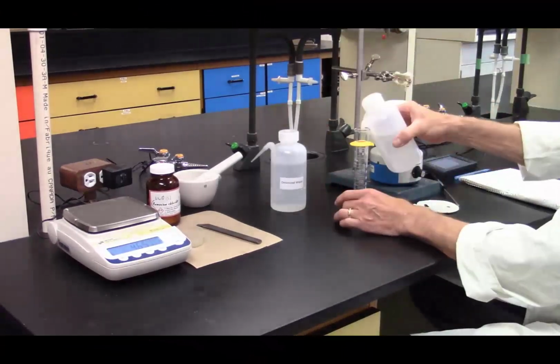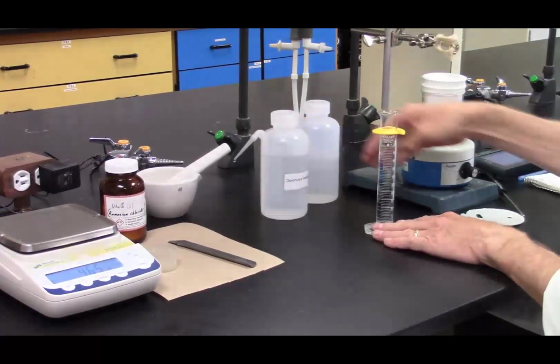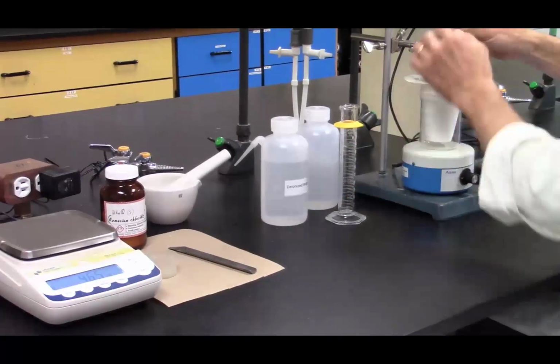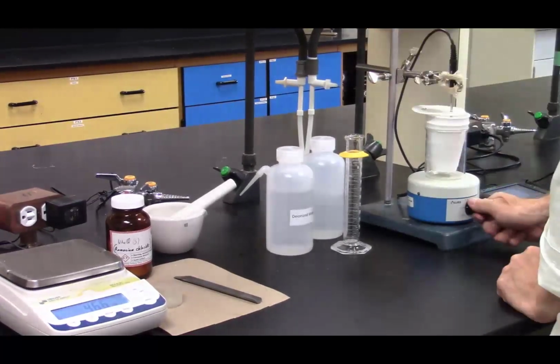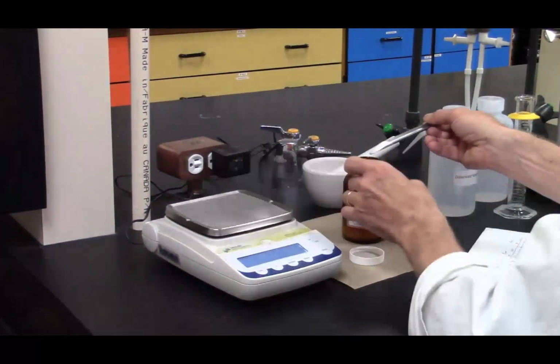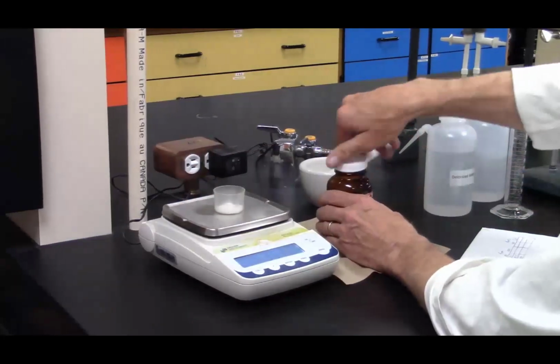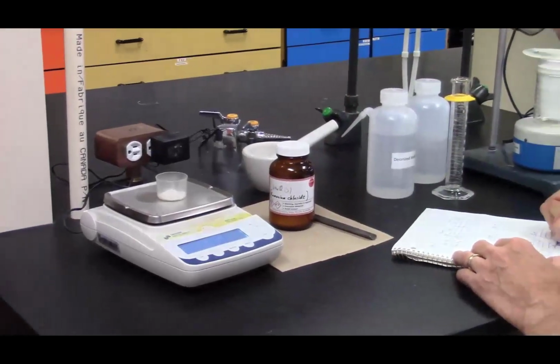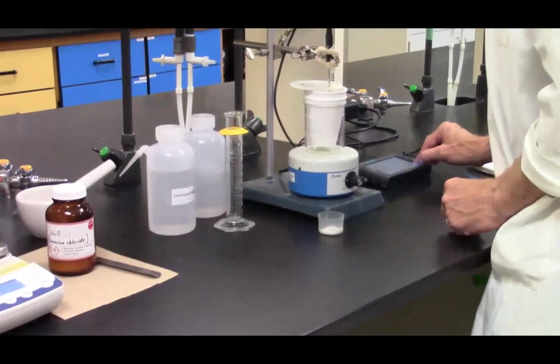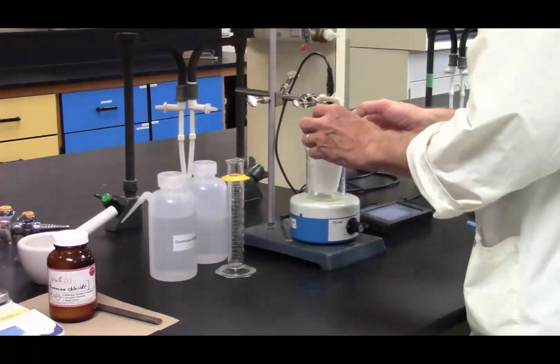In the lab, we see Scott use a graduated cylinder to transfer 50 mL of deionized water to the calorimeter. About 3.5 grams of ammonium chloride is weighed on the top loading balance. Scott taps the start button to start the temperature versus time data collection. When the temperature has stabilized, he adds the ammonium chloride to the water.